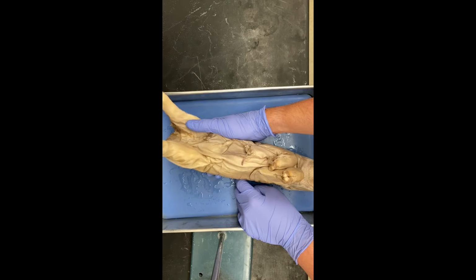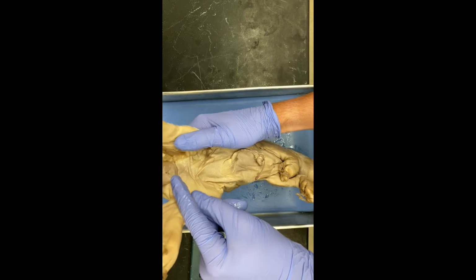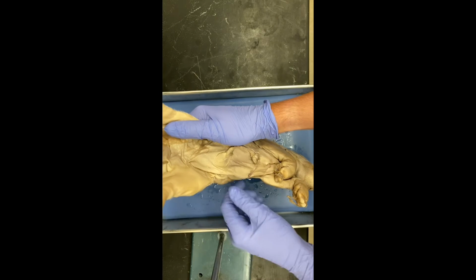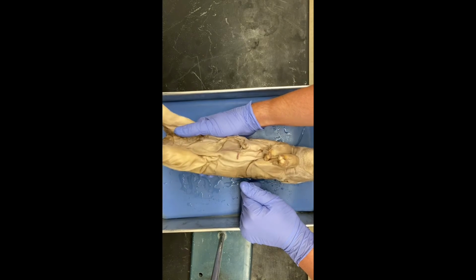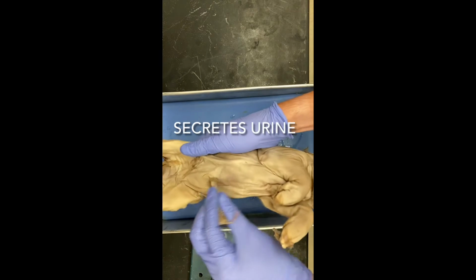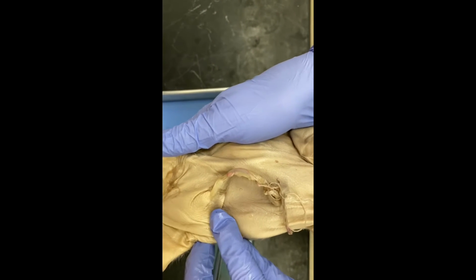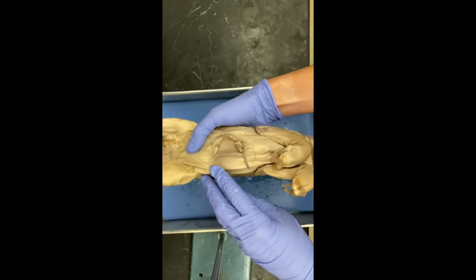We have the scrotum, which stores the testes, and in a pig that's not at term, the testes will be still up in the pig, but they'll drop down when the pig's mature. The urethral opening is right here. It's pretty non-obvious, but that's the urethral opening right there.